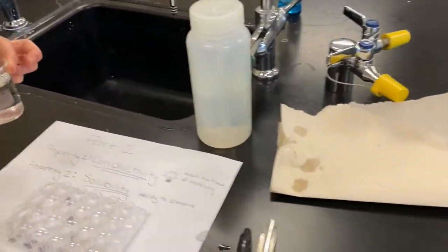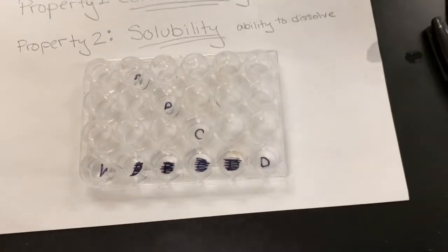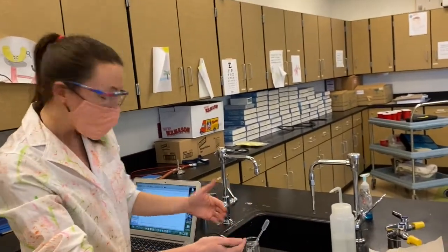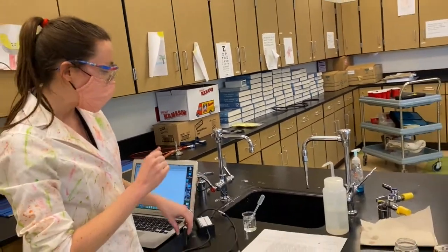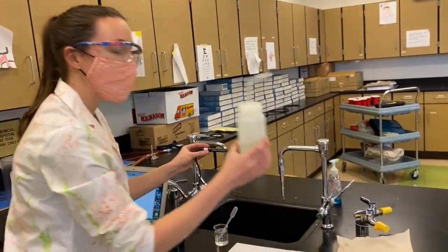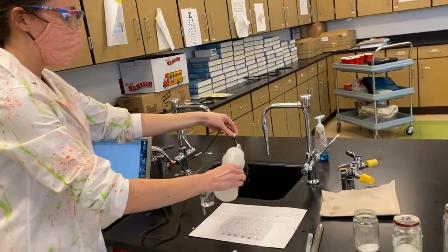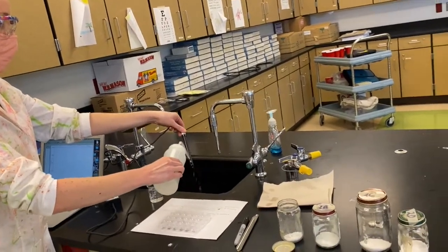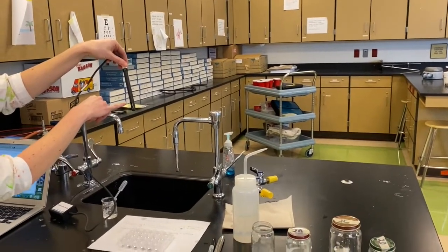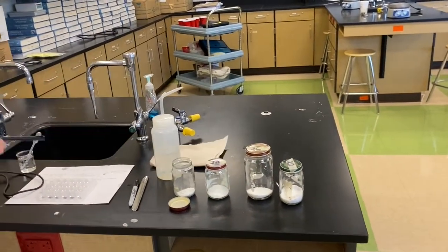Okay, so the other thing you want to watch out for while you're doing this part is not to cross-contaminate things. So it's very, very important for you to, once you read a sample and collect your data, take this probe and rinse it out over the sink. For that, we have a water bottle here filled with distilled water. And you're going to want to rinse that off right over the sink. This part down here, that's where the reading is happening, inside that piece. So you want to get that nice and rinsed. That way you get a true reading of each of your samples.